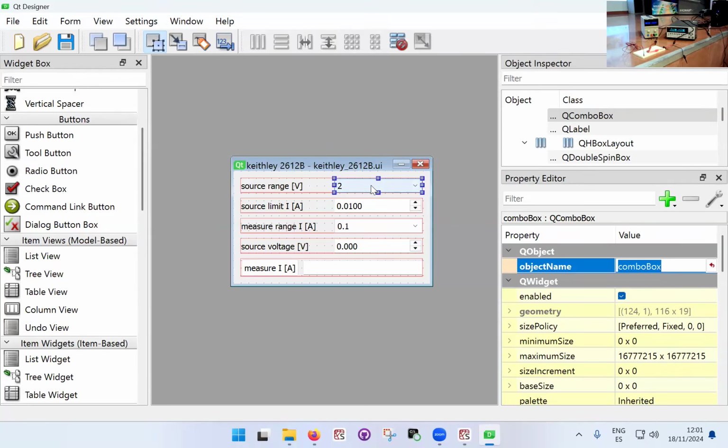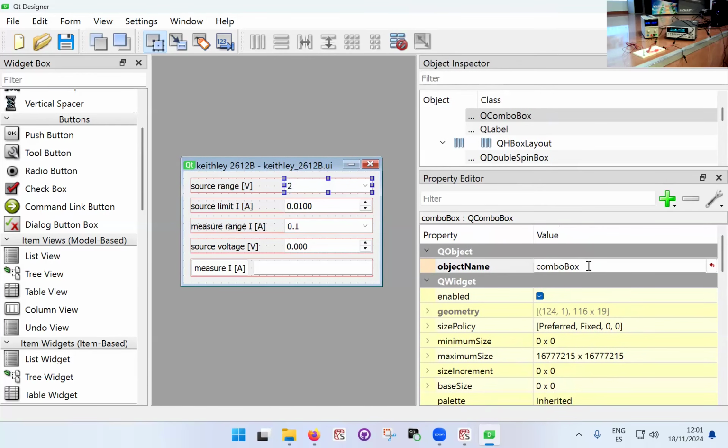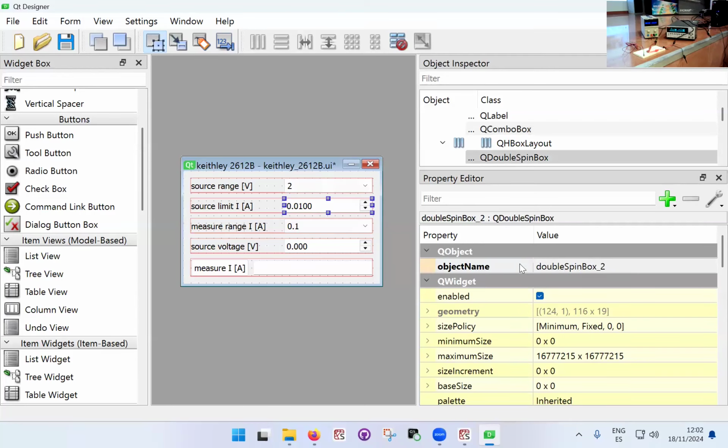For this reason, it actually makes sense to rename all these widgets with names that make sense. It's a matter of personal style, I like to put slightly longer names that are descriptive, because when you program some more complicated things, you can get a big mess of variables and objects. So what I usually do is put something that resembles the label and the name of the variable it relates to, so that when I come back to the code after a few months, it still makes sense, and I can go in and change it relatively quickly. So here I'm going to call it source range combo box, and I'm going to do the same thing here.